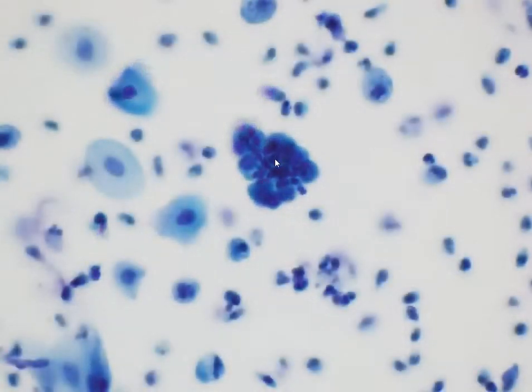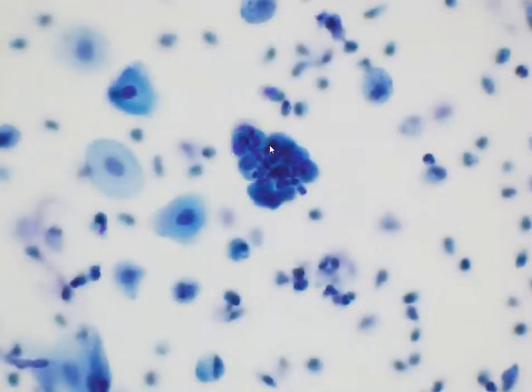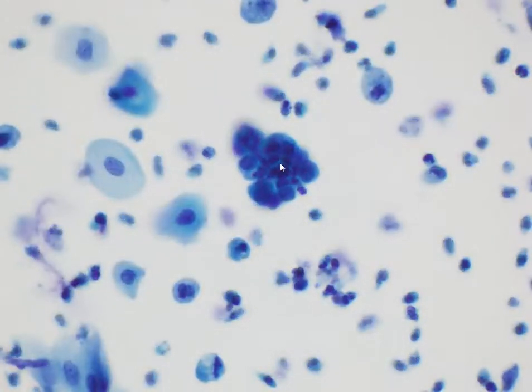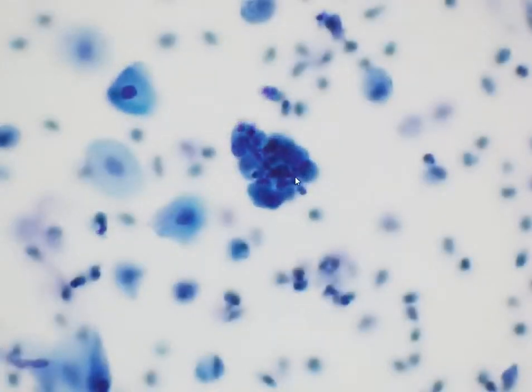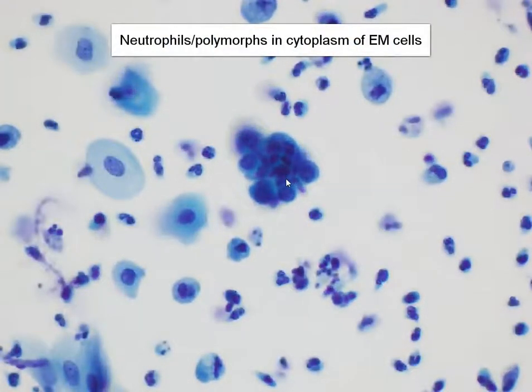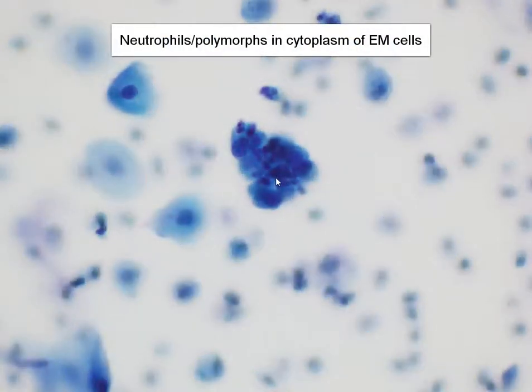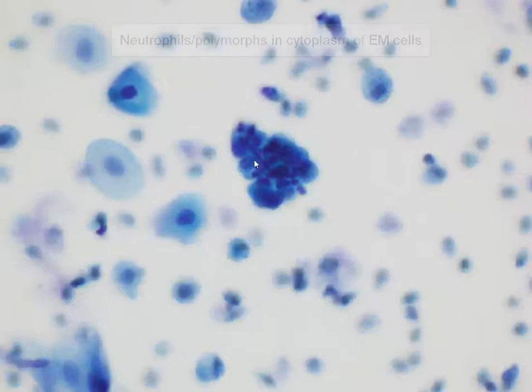We can appreciate that there seem to be a lot of smaller cells here, and some of them have got multi-lobed nuclei. These are neutrophils — neutrophils within the cytoplasm of some of these atypical glandular cells.